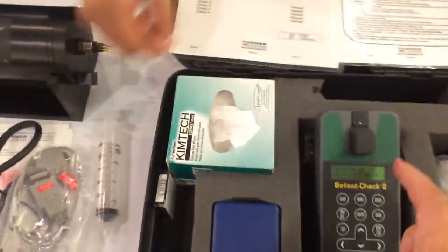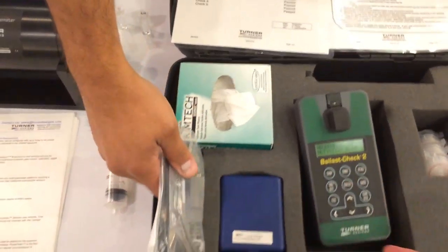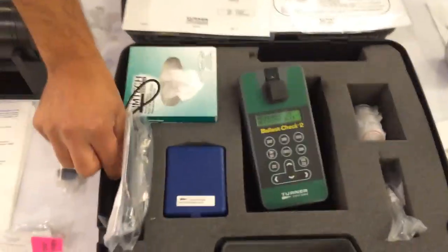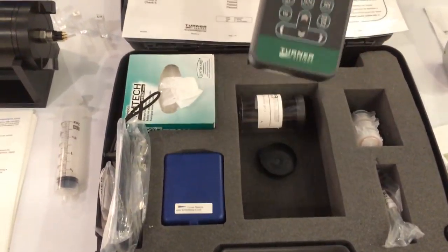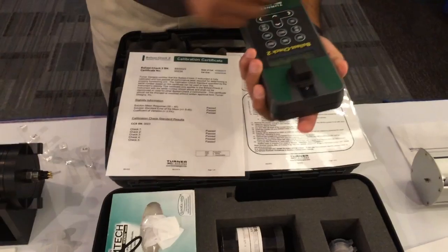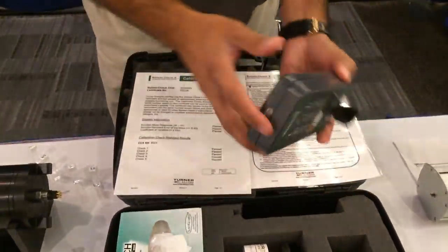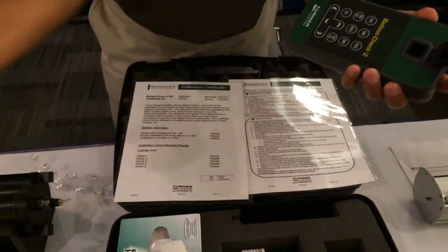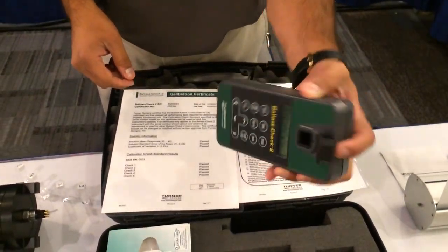So this is designed to be hooked up to your computer. You're typically not doing this in the hold per se, but this will store 1,000 data points for you, so you can just start running your samples wherever you are. And then when you're done, you plug it into your computer, say send data, and all the data gets sent to and stored on your computer.